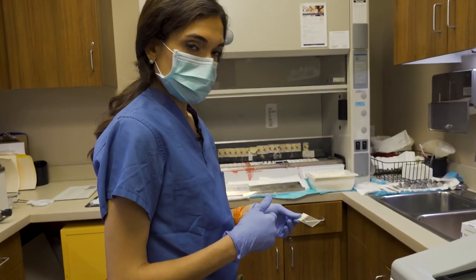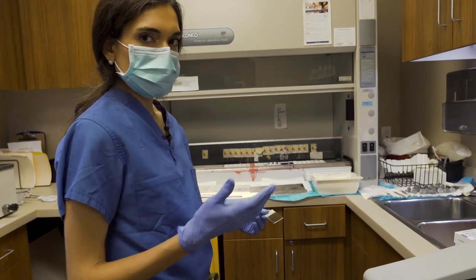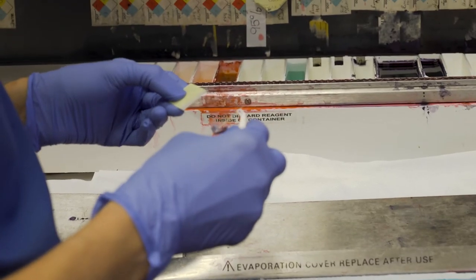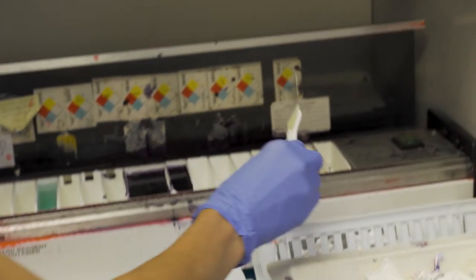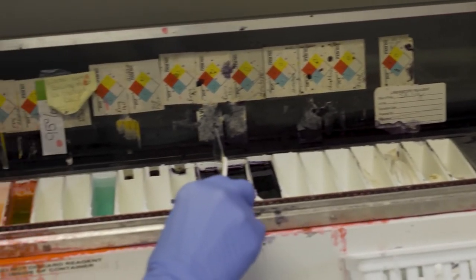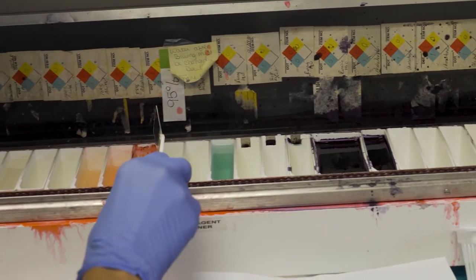When it's on the slide you will not be able to see the tissue under the microscope — it'll be totally clear. That's where we come and ink the specimen so that when we look at it under the microscope we'll see the tissue with usually a range of pink and purple to blue. We attach the slide to one of these holders like a conveyor belt, which connects here, and essentially this machine takes the slide through all these inks and allows the tissue to be stained.